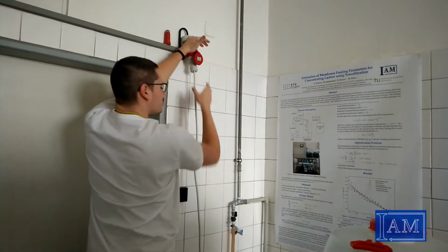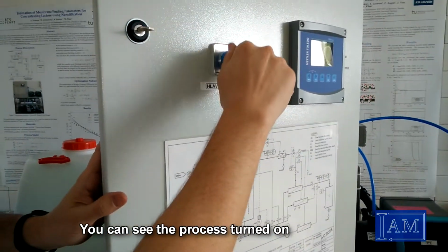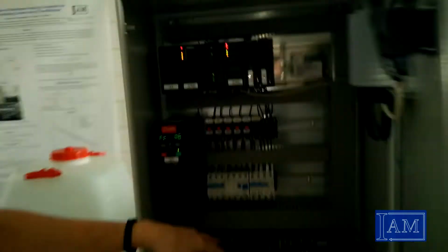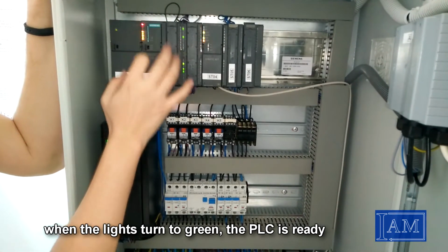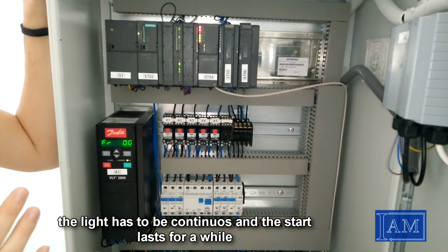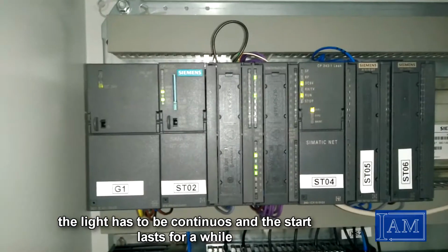We will power up the device so you can see it turned on. When the lights turn to green, the PLC will be ready. The light has to be continuous and the start lasts for a while. At this moment it's up and running, and if we take a look at the display it shows the values now.